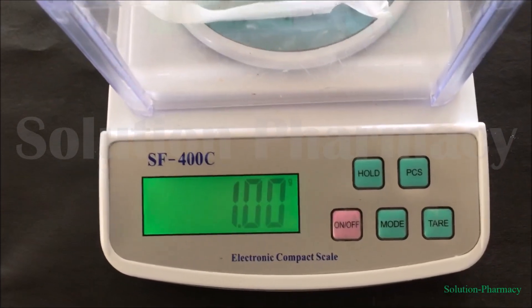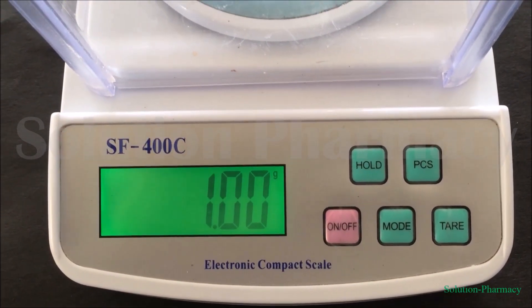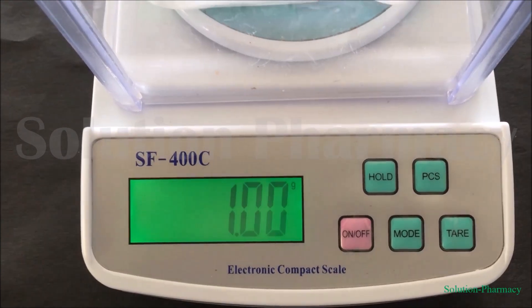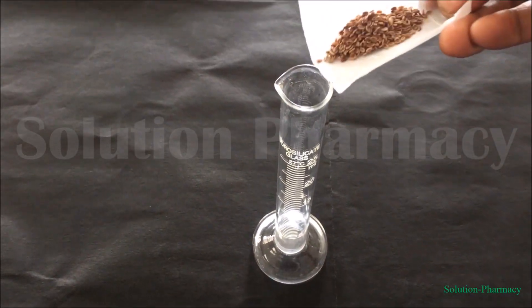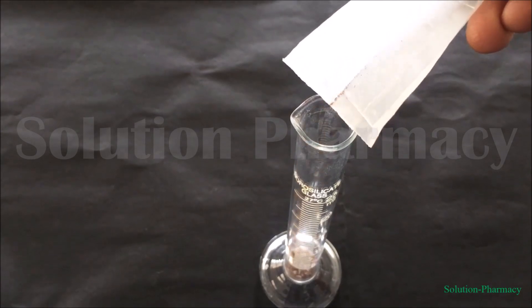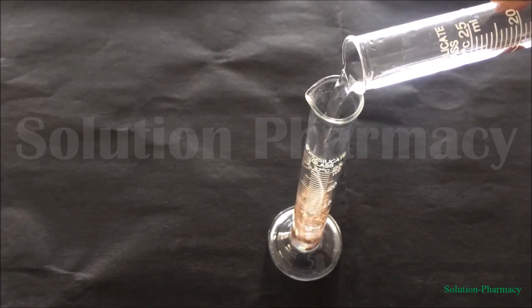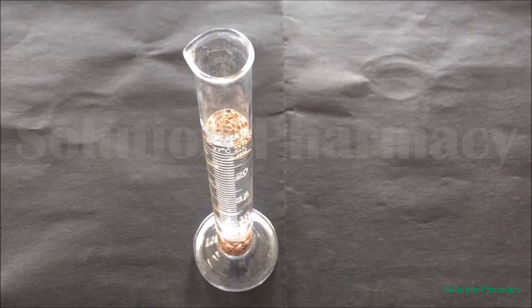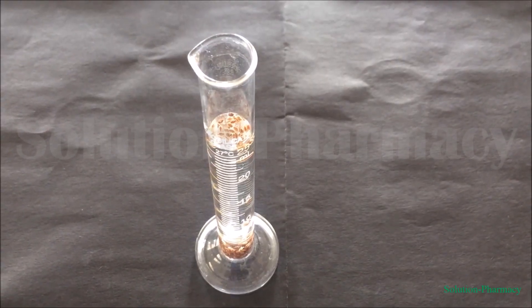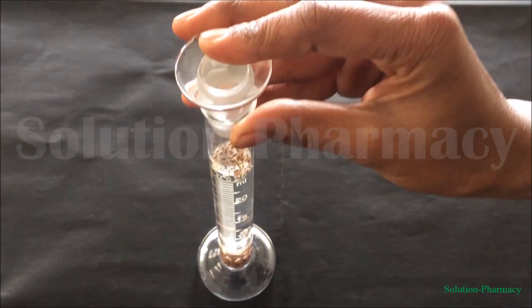First, weigh one gram of the drug — that is, isabgol seed. After weighing, transfer this one gram of drug into a stoppered measuring cylinder of 25 ml capacity. Then add 20 ml of water into the measuring cylinder containing the isabgol. After some time, all the floating isabgol seeds settle down at the bottom.